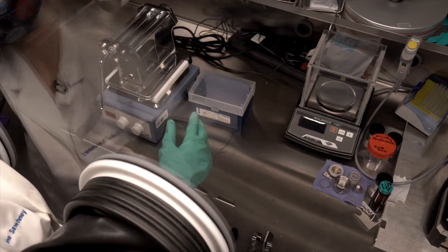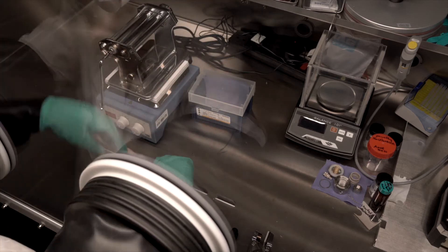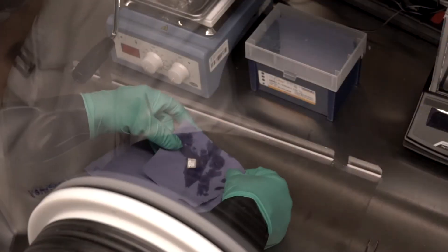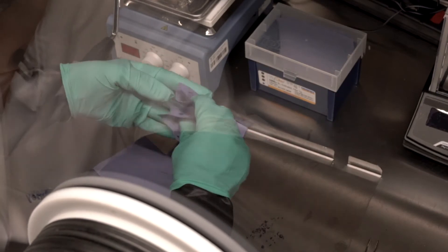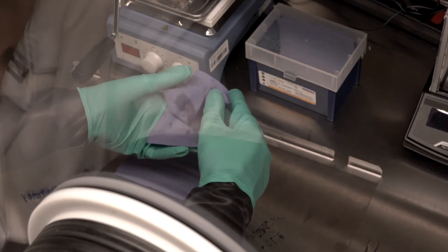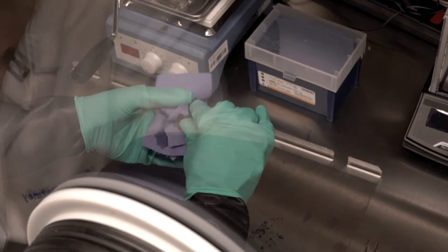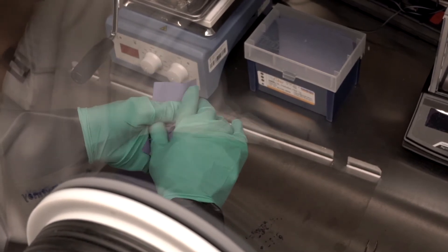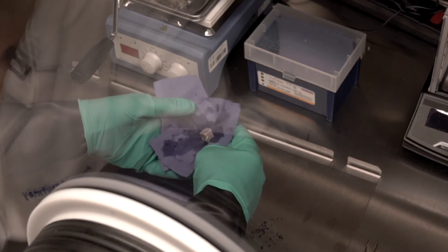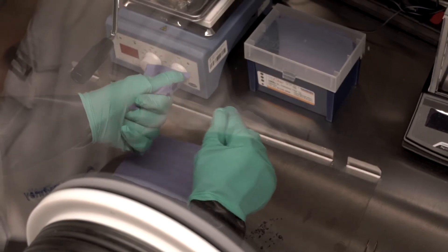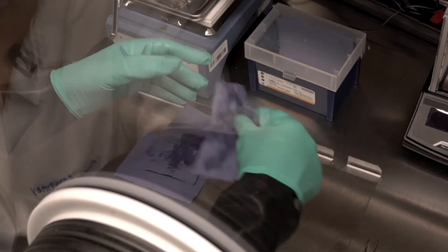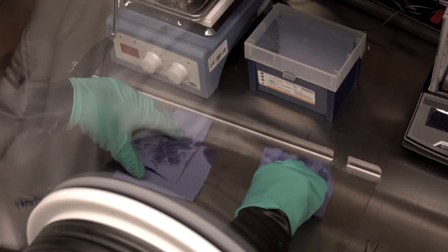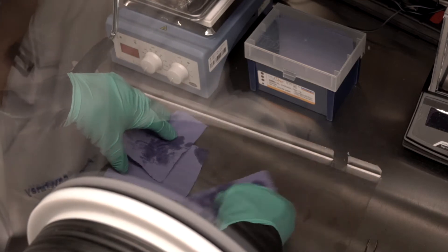And I reseal it. The last thing I want is that to spill. You'll see the cube is wet with mineral oil. I'll dab it off. But I don't have to worry about that mineral oil evaporating and filling up my solvent filter. It's also quite nice to have a wet wipe to mop up any mystery powders in the area.